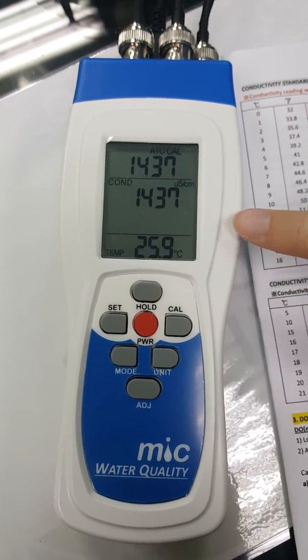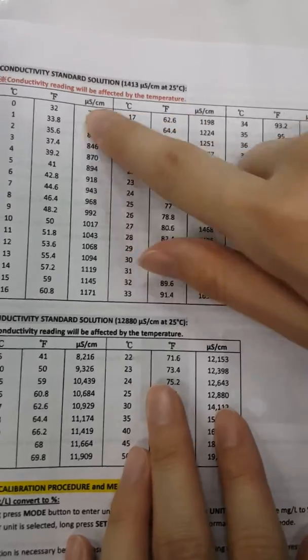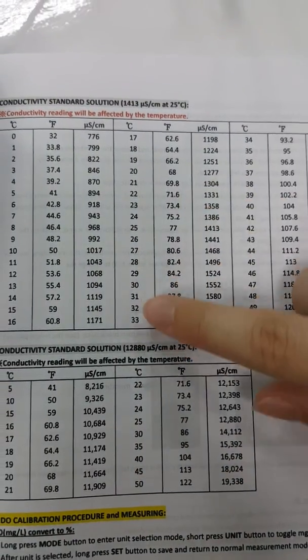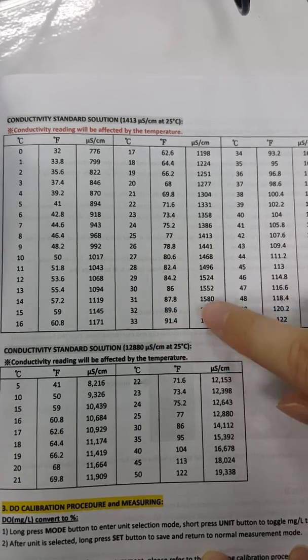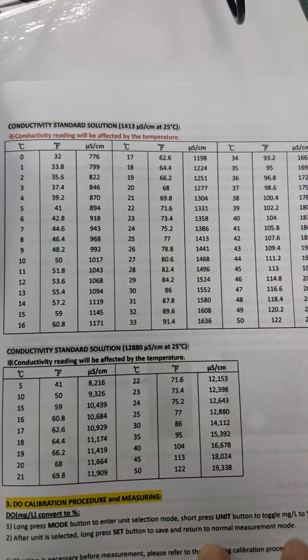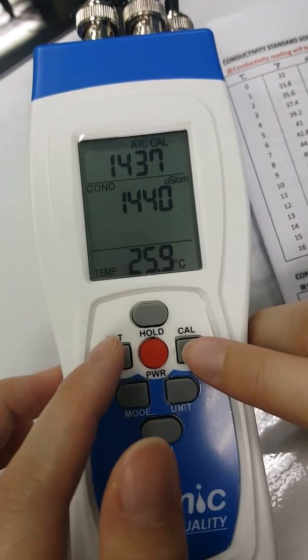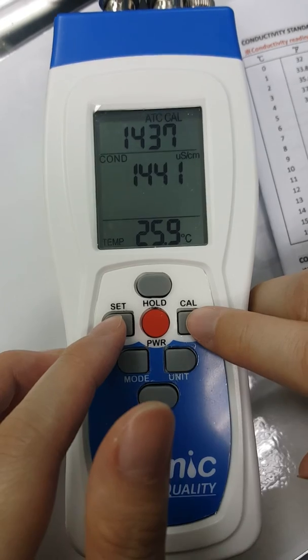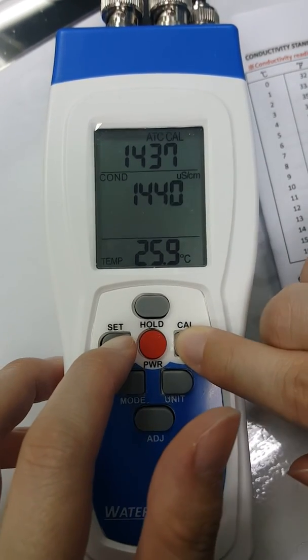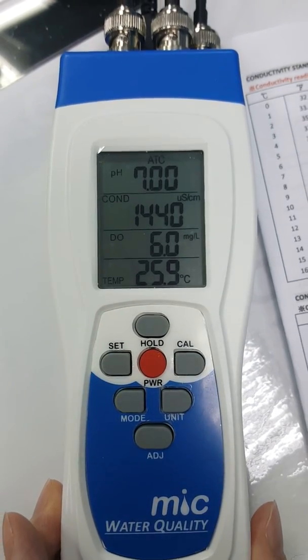Please be informed that the temperature will affect the conductivity readings, so you can compare the temperature readings with the conductivity readings. If you want to escape to the normal measurement mode, press the set button and the calibration button.